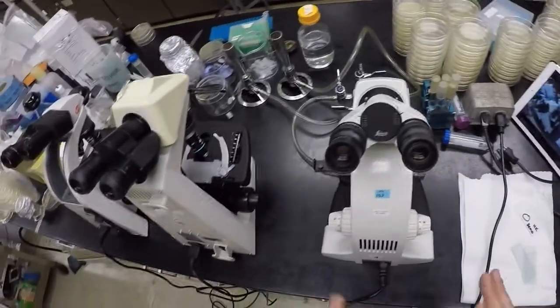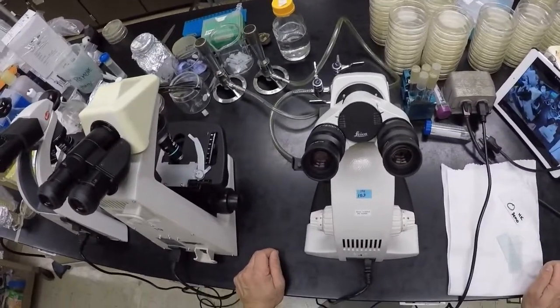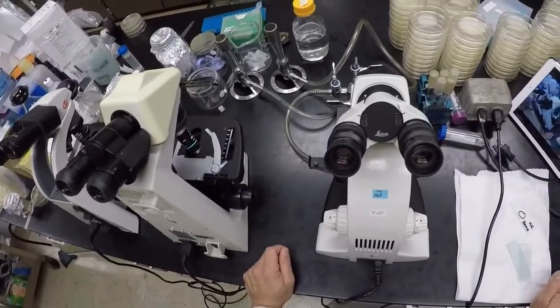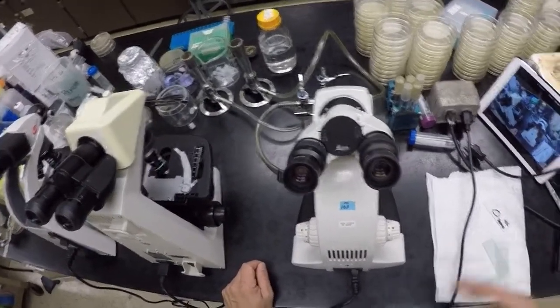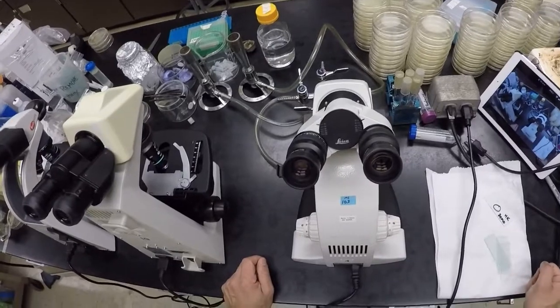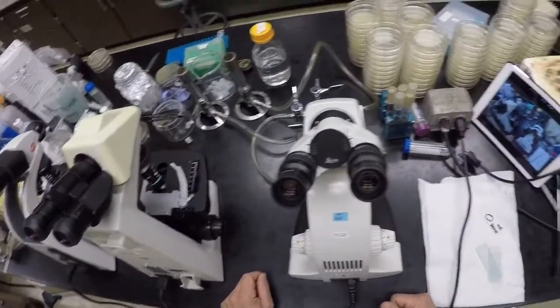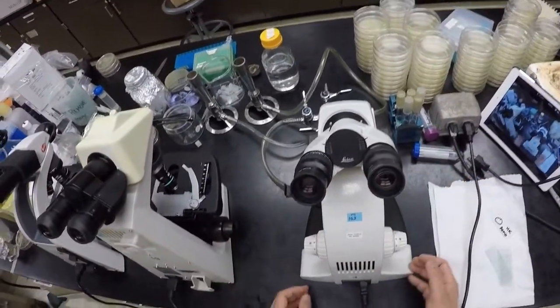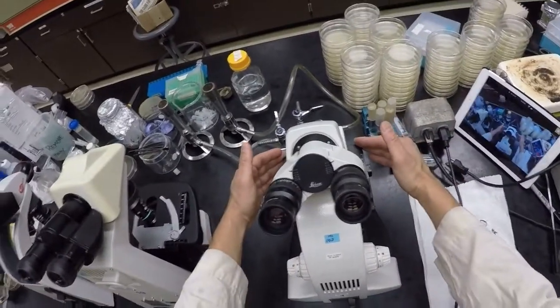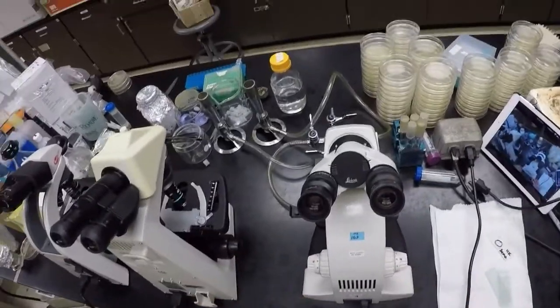So let's go over the super basics of how to use a microscope. We're not going to talk about every single part on this microscope, just some of the basic parts for the microscopes that we're going to use, and this video will also talk about how I want you to use the microscopes, the way I like you to use it. Now, when you set up your microscope, I like it with the spine facing you and the stage on the other side, right? And this allows, I'll show you later, for the easiest control.